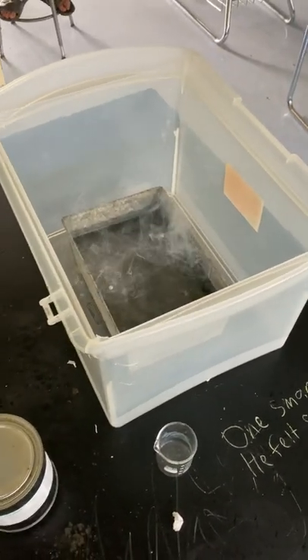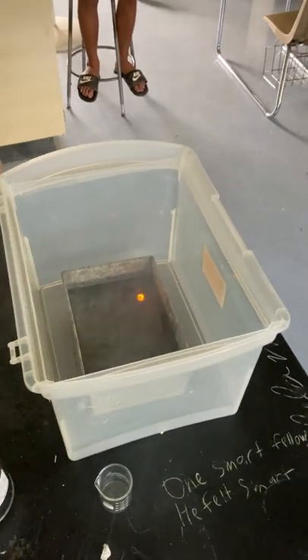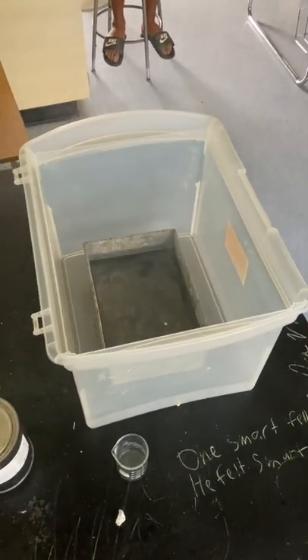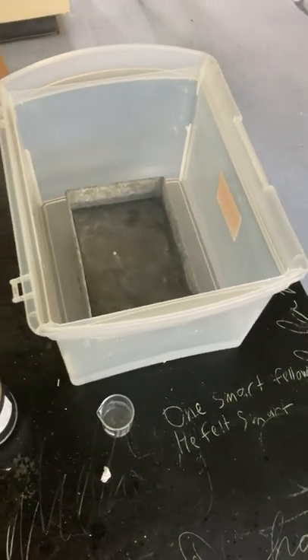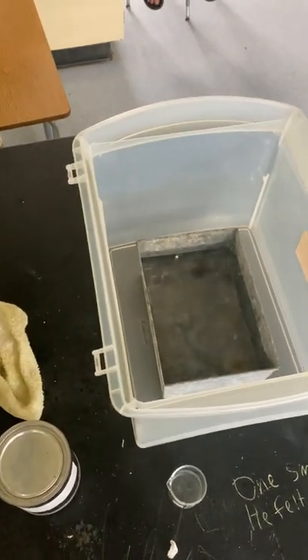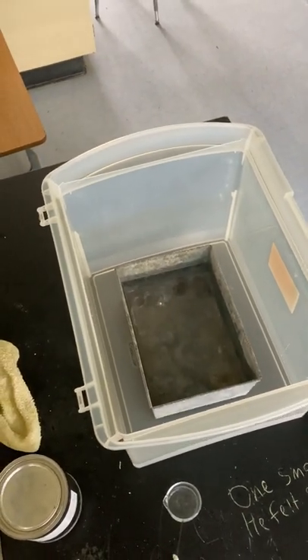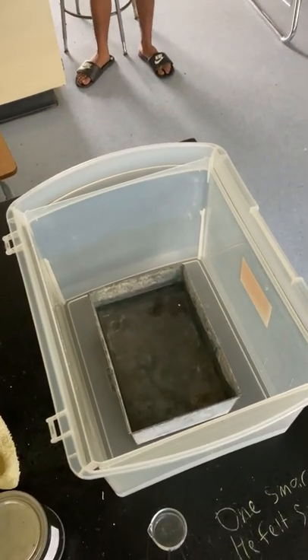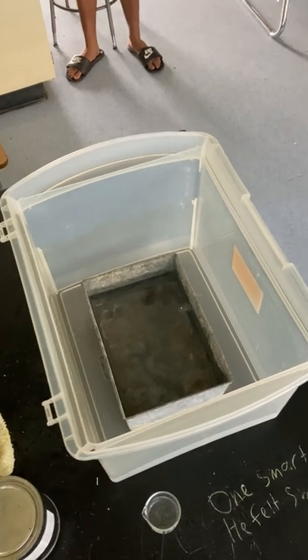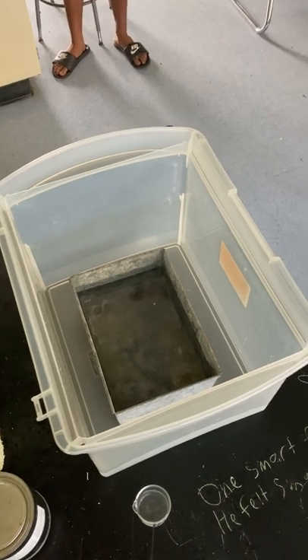Can I look over it? No. [Explosion] Holy crap, mister! I said you couldn't look over it. But you said nothing was gonna blow up — I said that for the lithium. I made no such claims about the sodium — I said this one was going to be more reactive. It's still going. Yeah, it caught me off guard too. That was a lot more reactive than expected.